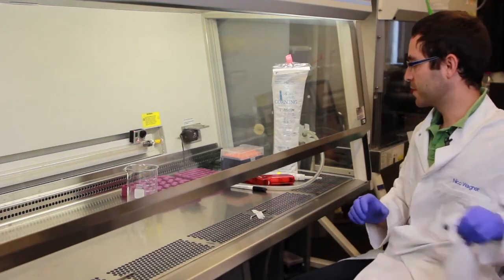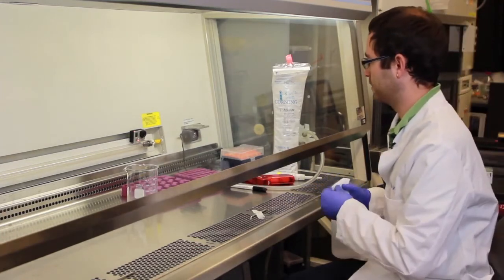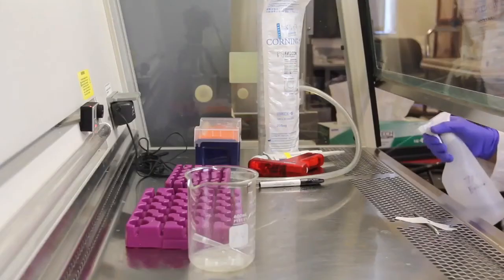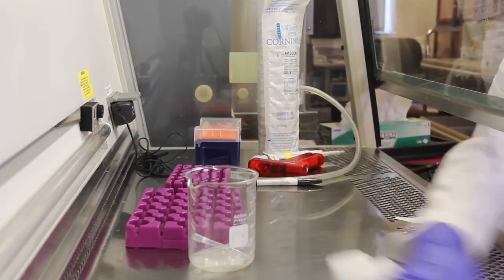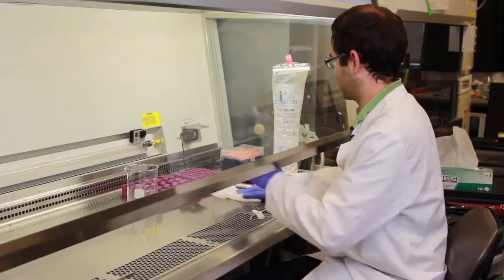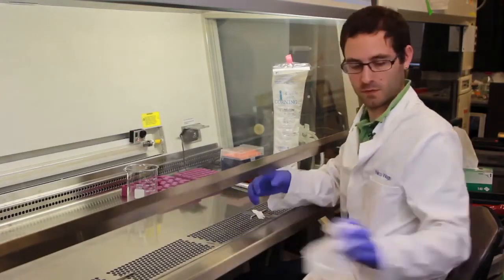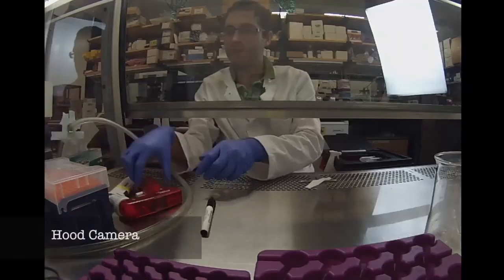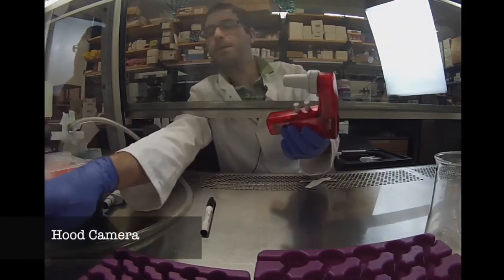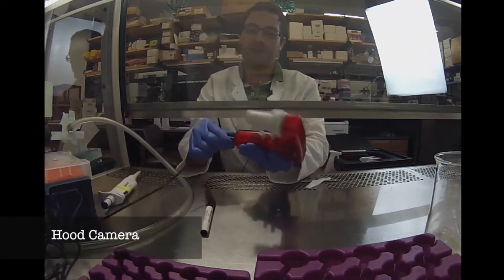And the final step to make sure everything is clean for the next tissue culture user, I take ethanol again and spray down all of the surfaces that I touched, wipe them off, and move all of the things back where they started off and reconnect this pipette man to its power source.